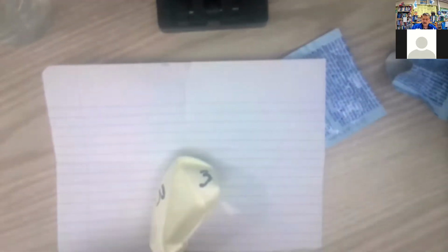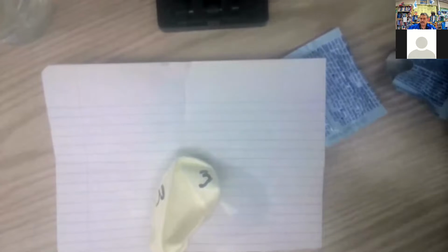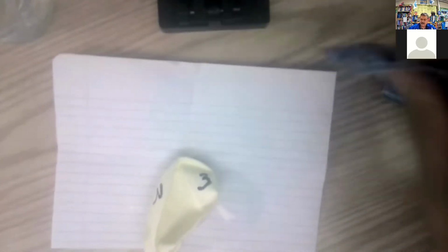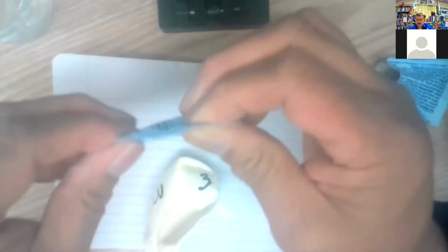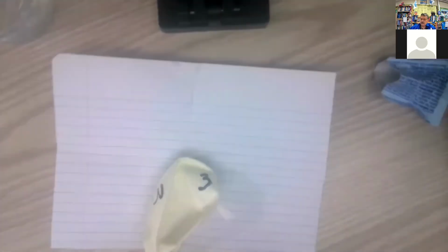Okay, so there's 1 tablet's worth, and then a little bit right here. So we'll pick that up after I get 2 tablets and make this 3 tablets. So I'm trying to shake all the powder to one end so I can open this up. And there we go.